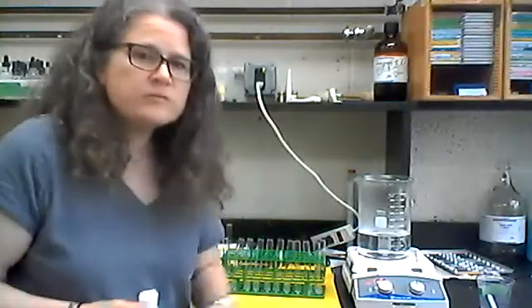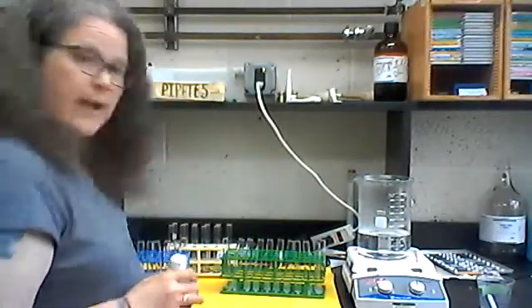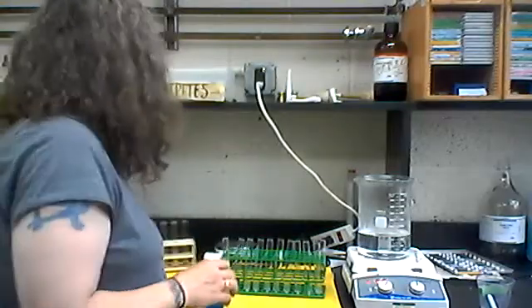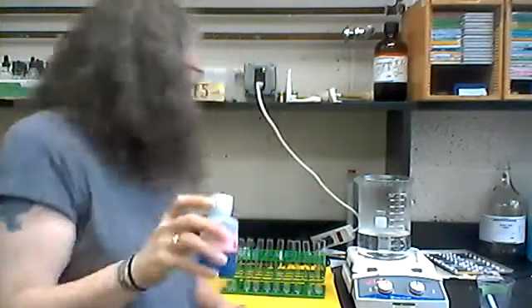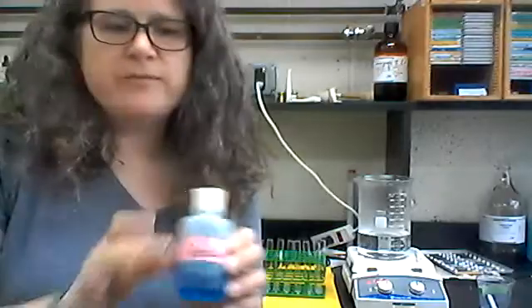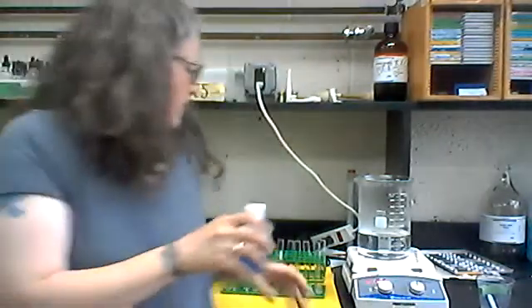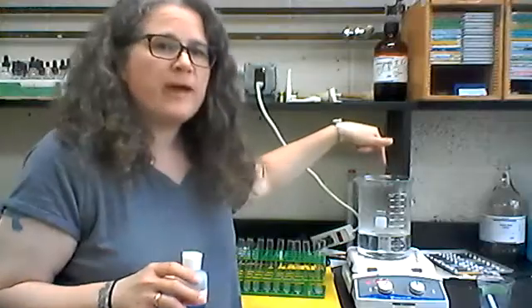Okay, so I have all of those carbohydrates loaded into these racks here. Now we're just going to focus on one of these at a time. Our first test will be using Benedict's reagent. This is blue reagent, and this is testing for reducing sugars. So I'm just going to add to each one of these two milliliters of Benedict's reagent. And then I will go ahead and put them in this boiling water bath and let them sit and let the reaction take place. I'll show you what that looks like.